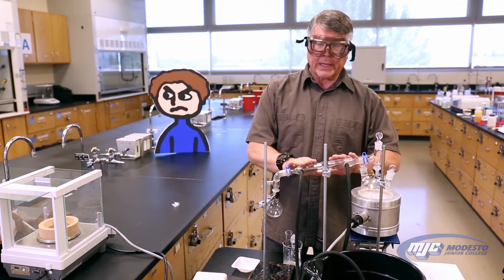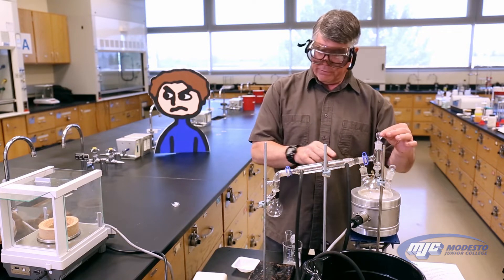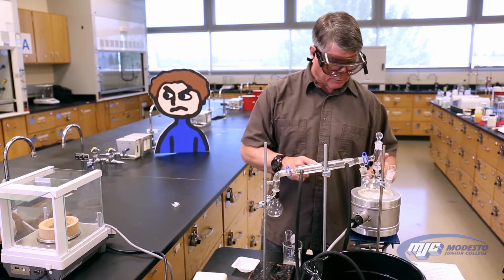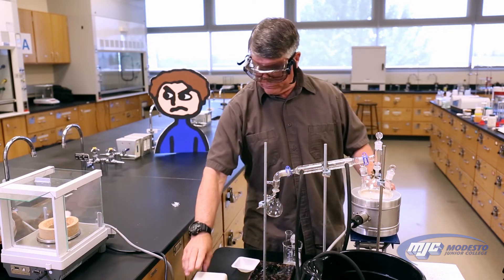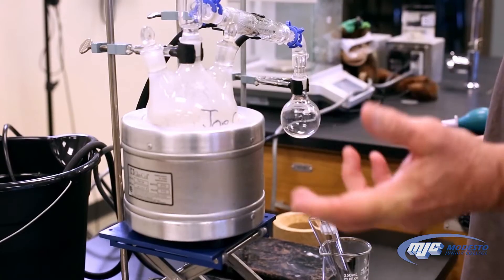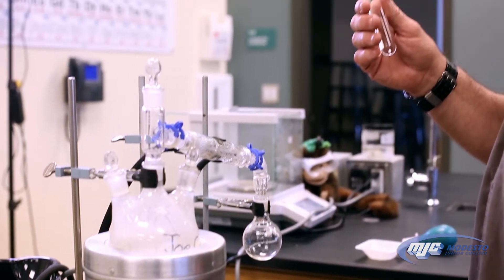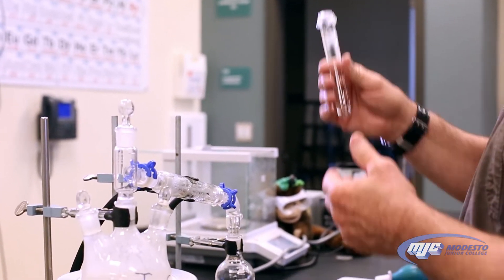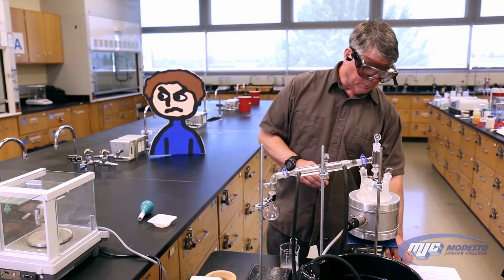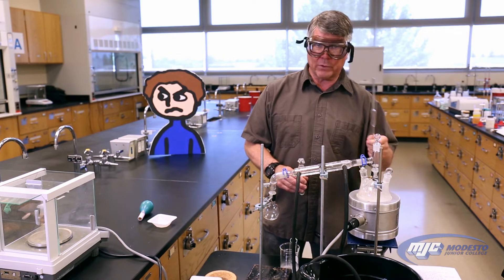So now we're ready to go. I already have cold water running through the jacketed condenser. Everything's attached and stoppered up. This is the heating mantle — it's connected. All I have to do is turn it on. And now we're cooking. So now that we have our distillation started, we're going to measure the mass of 10 milliliters of our same unknown solution — we get a little bit more of the same solution. We're going to use a volumetric pipette to measure out the volume, so it's going to be 10.00 milliliters — four sig figs from the volume.